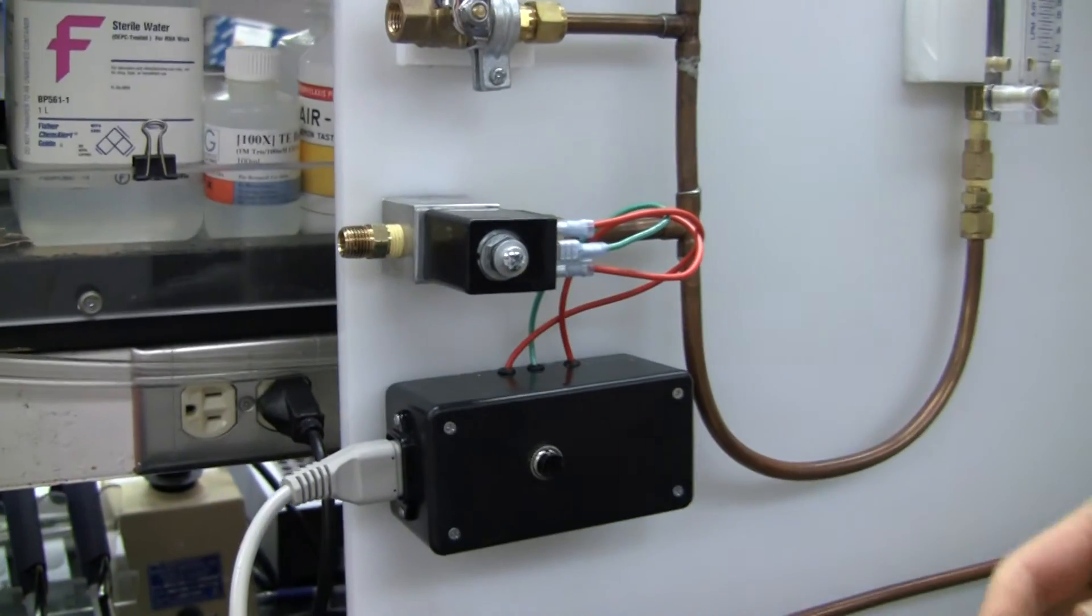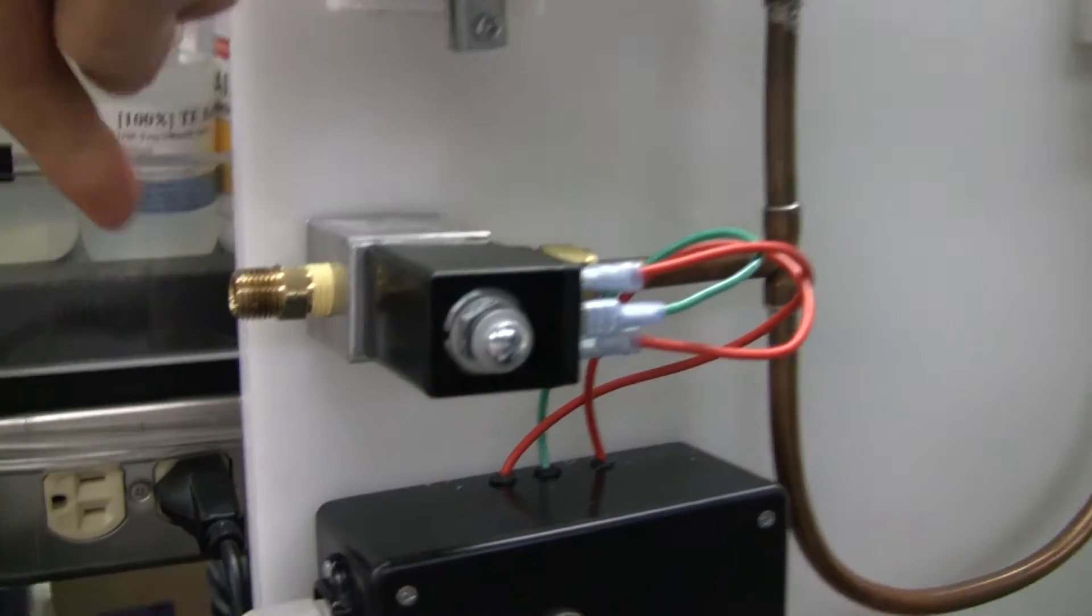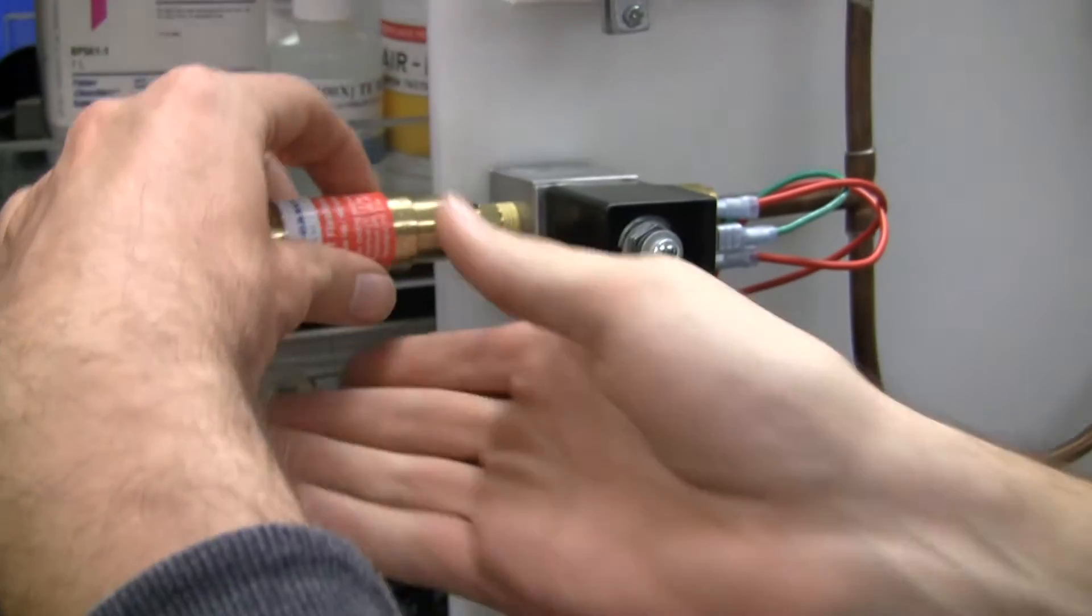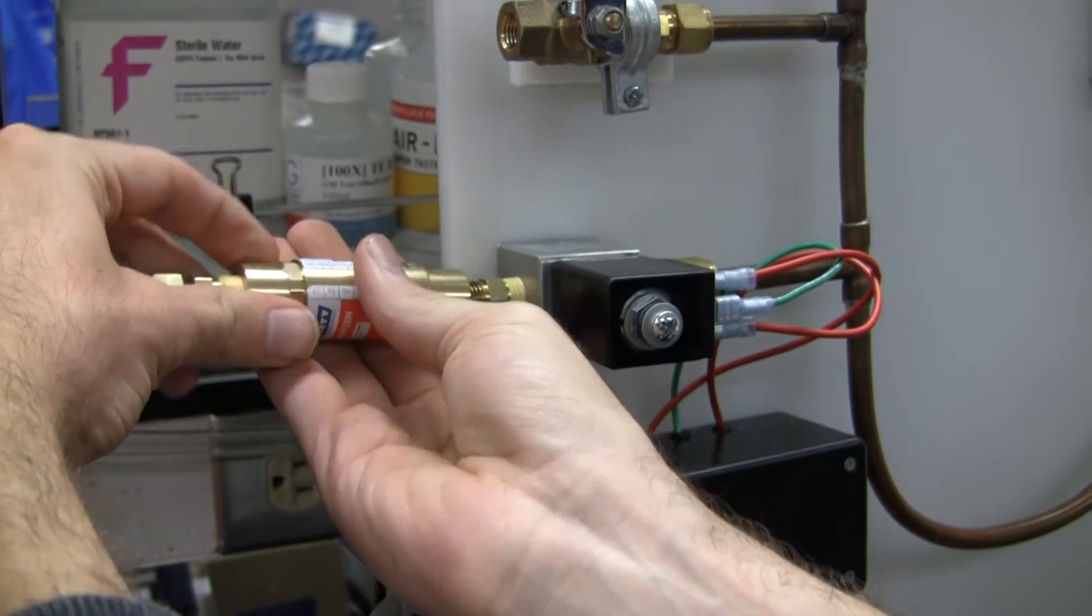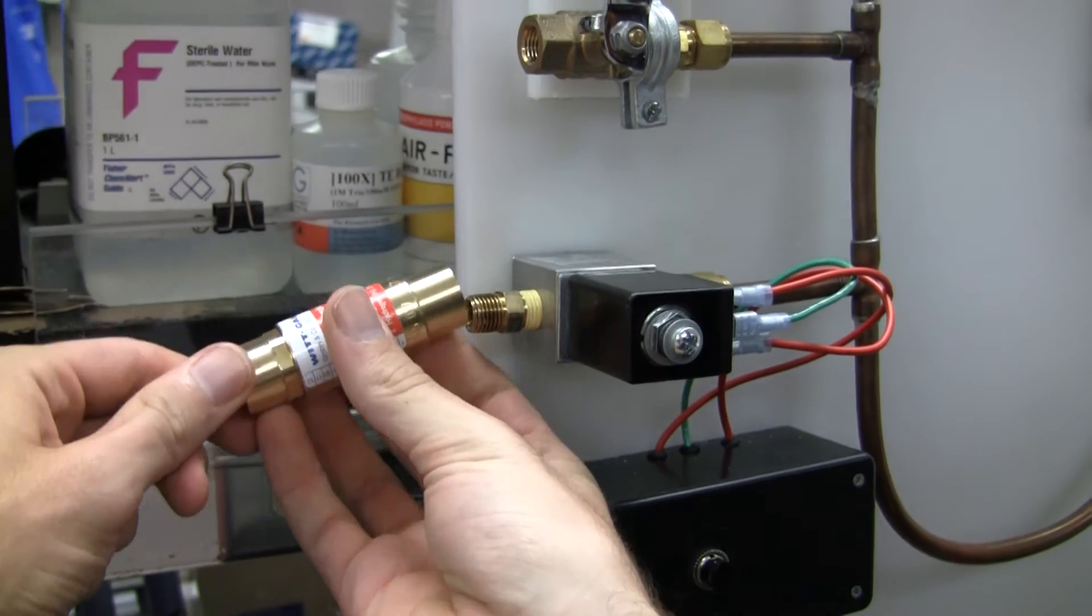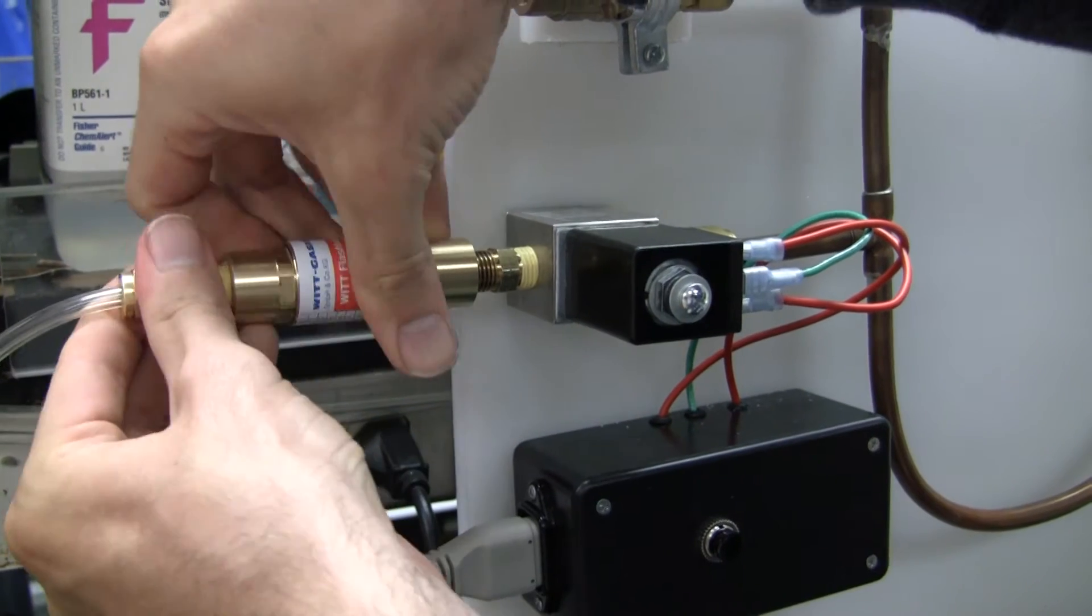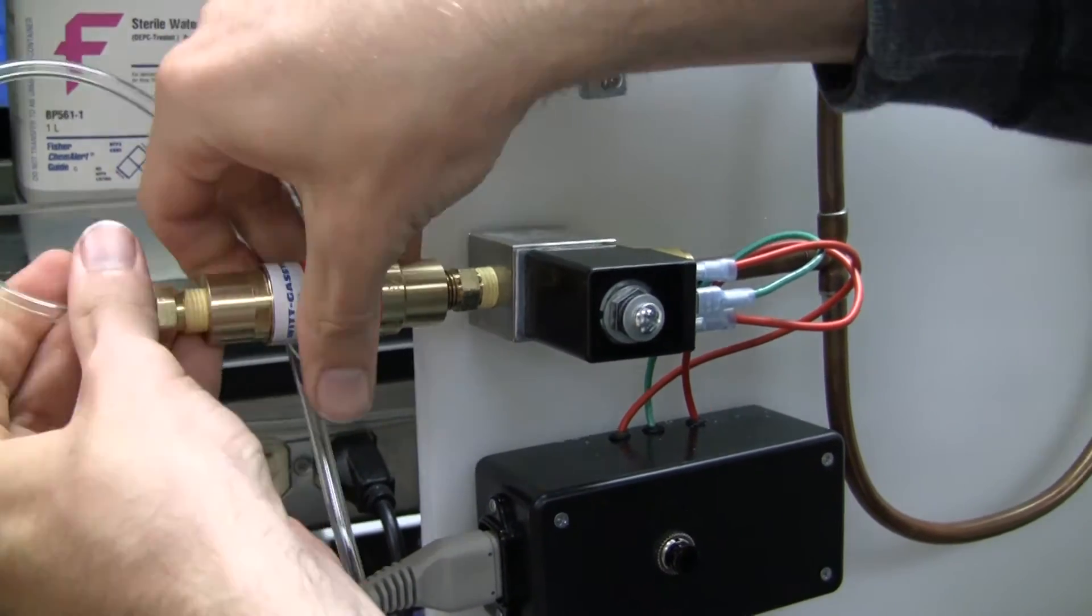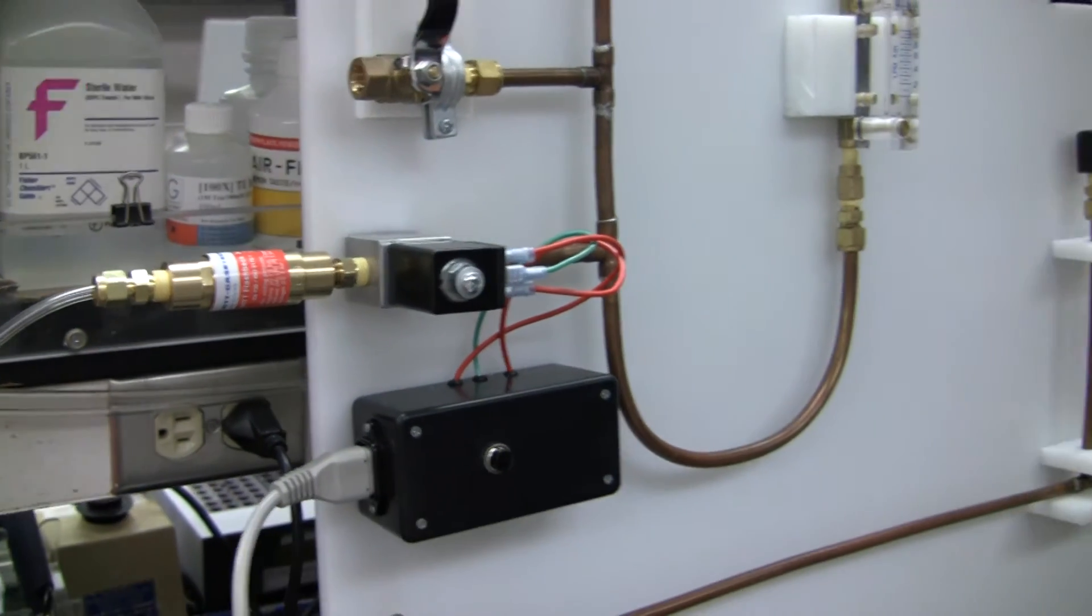What you're going to want to do is put some Teflon tape around there, and then just take this and hand screw it in. That should work very well for you.